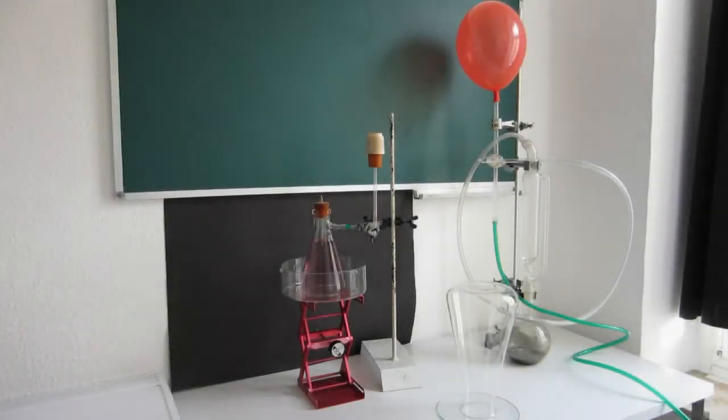Gases can build up diffusion pressure. In the following experiment, a filtering flask containing a rising pipe which leads into colored water is hooked up to a porous pot through a glass tubing.